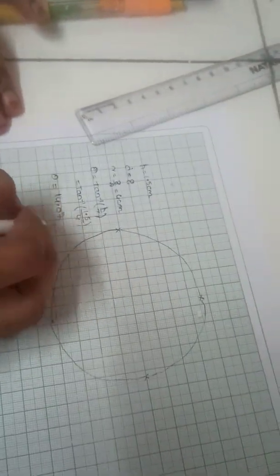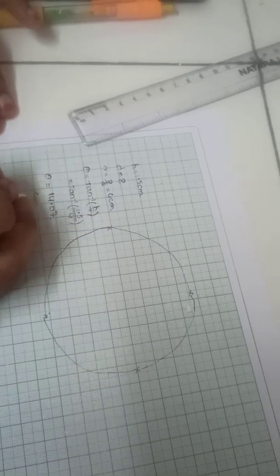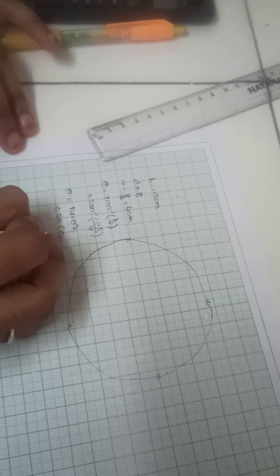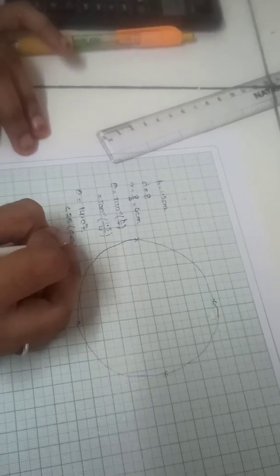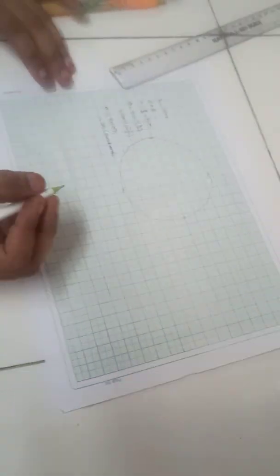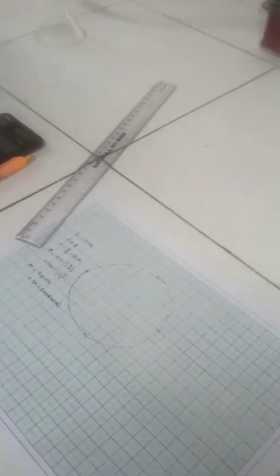Here also we got a flow property value less than 25, which indicates excellent flow. So this is how we determine flow properties by the fixed funnel method and the open cylinder method.